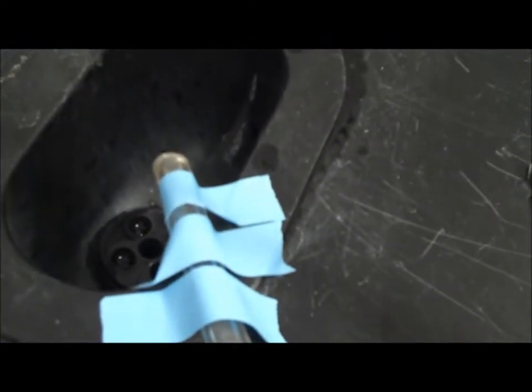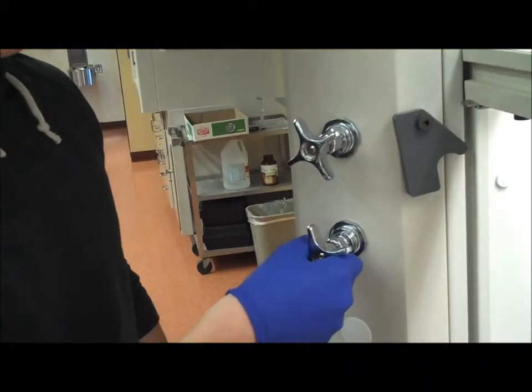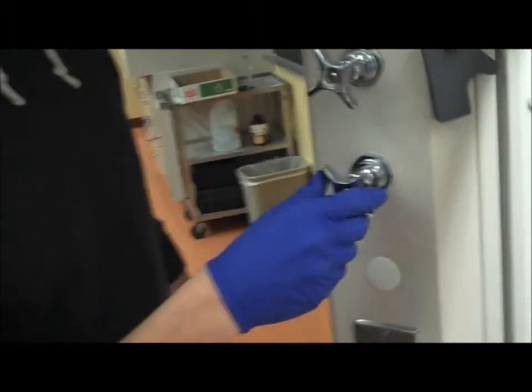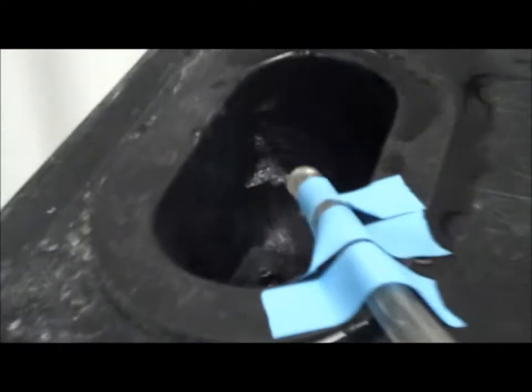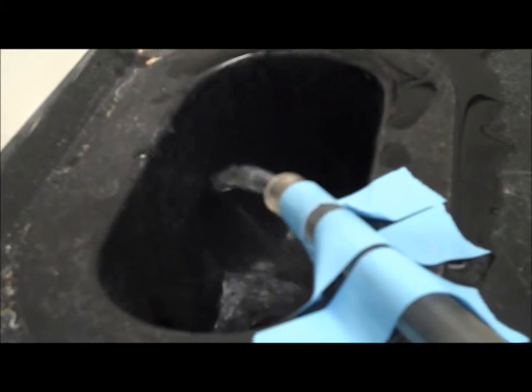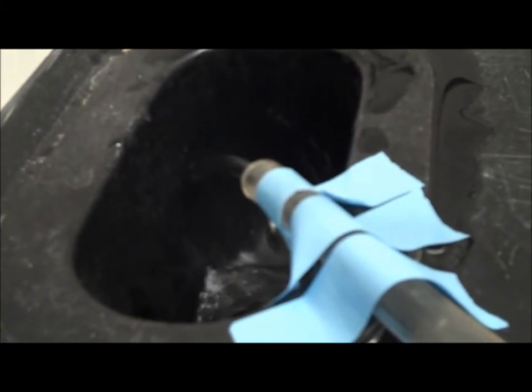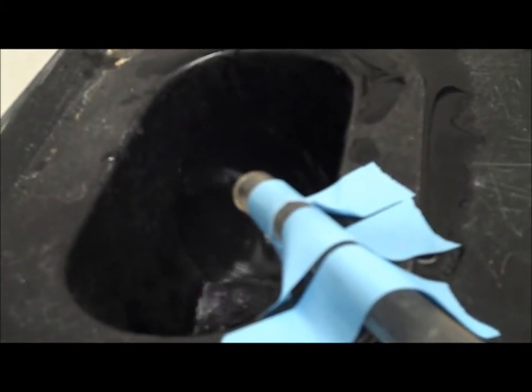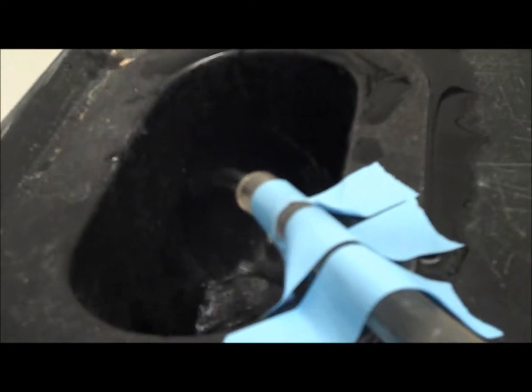Make sure the water flowing out is taped down to the sink. Now, turn on your water. The speed of your water flowing through the tube should be at a slow, steady pace—not too fast—to ensure that you get the best distillation possible.